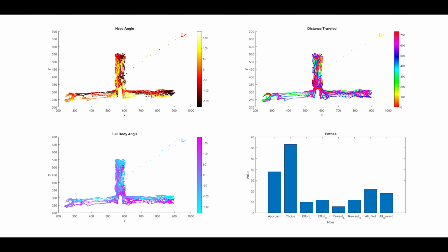Guys, I'm realizing I'm getting very close to the 10-minute mark, and I will stop this tutorial right here and follow this up with part 2 in the future.